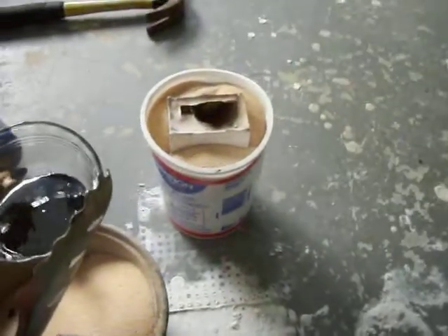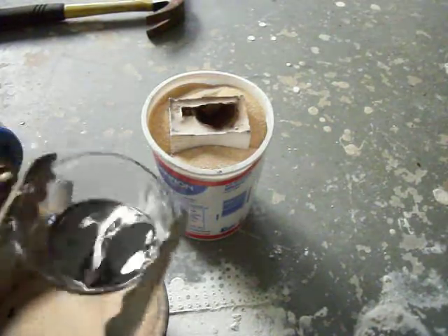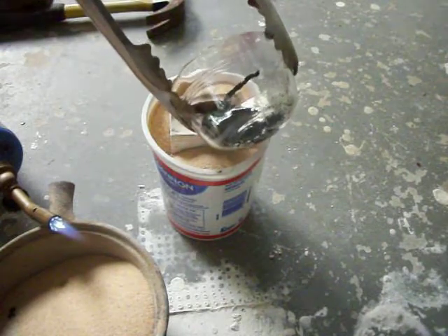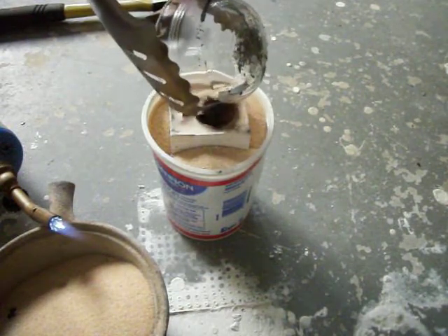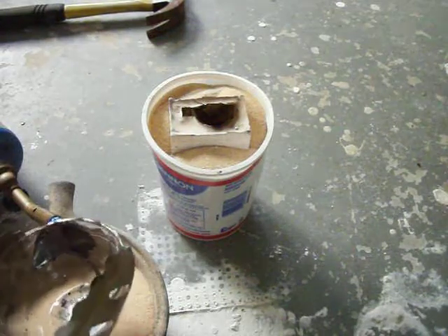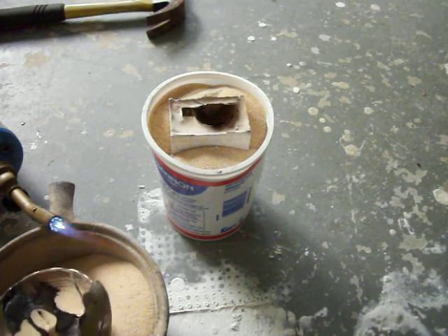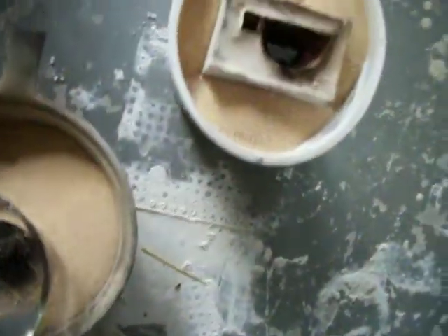Okay, let's get this ready. I just heard a crack — let's pour this. I thought I heard something — yes, you'll see a crack in the pyrex dish, so I may have heated this a little too quickly, or maybe squeezing with the tongs or the open flame was a little bit much. But it did not shatter the dish and I was able to pour into the mold.